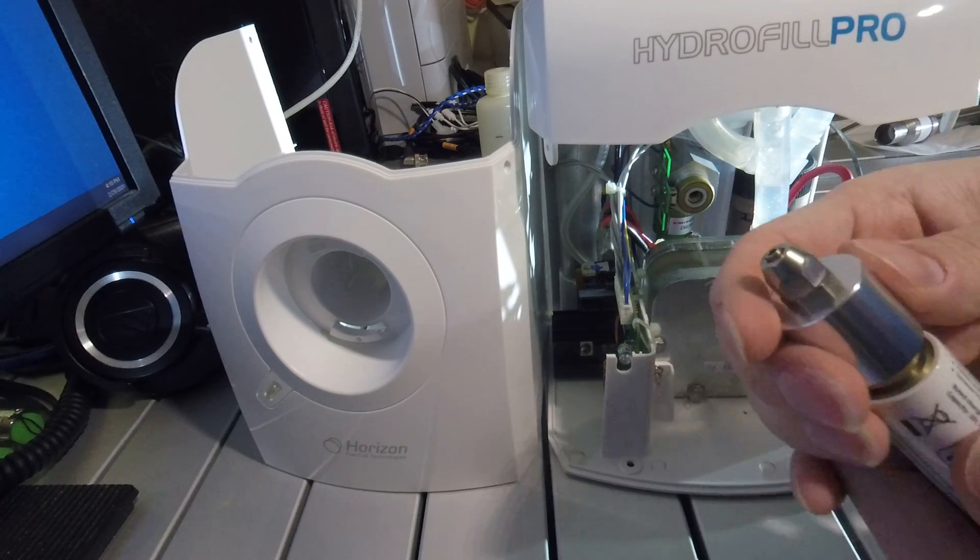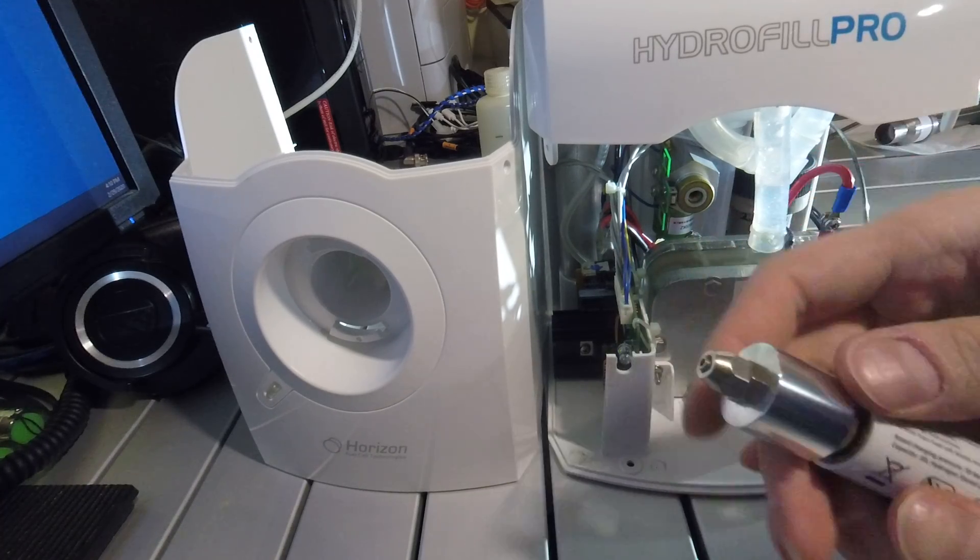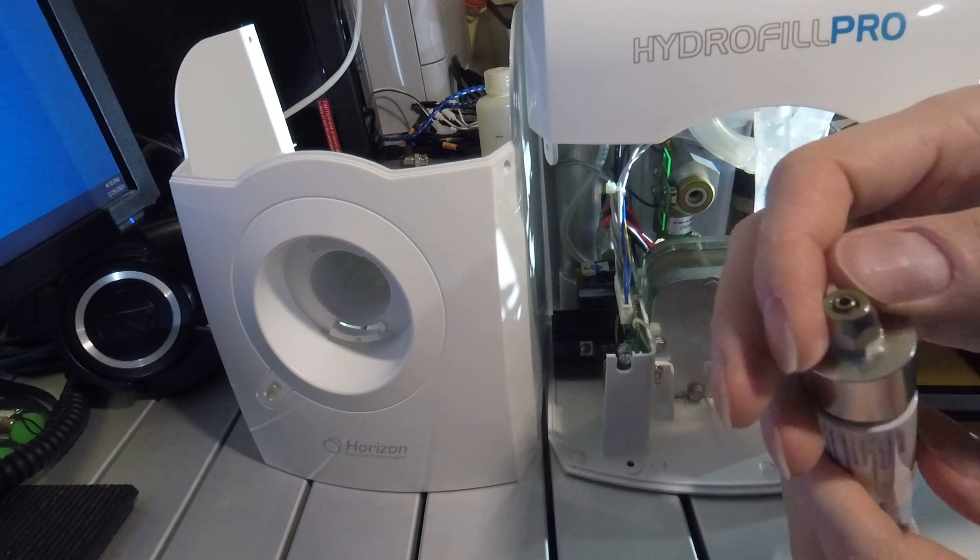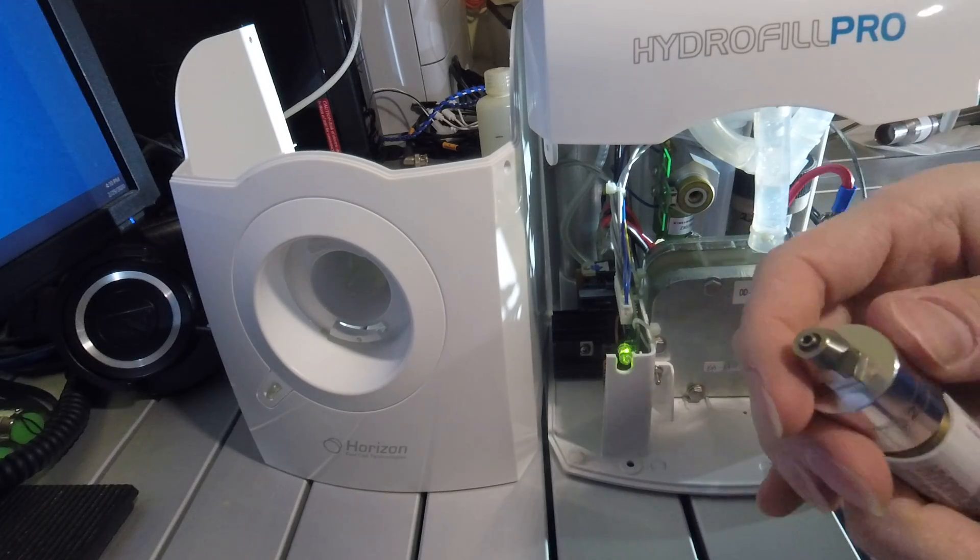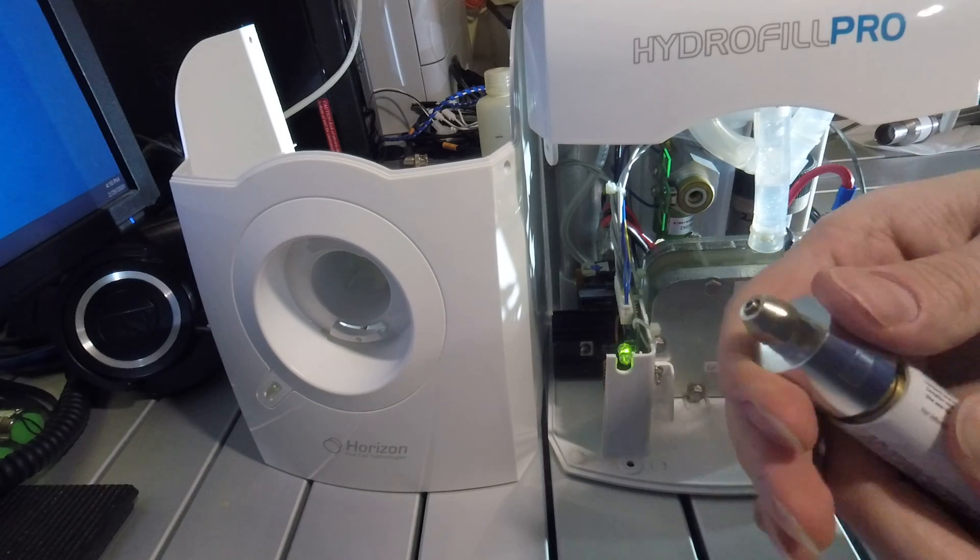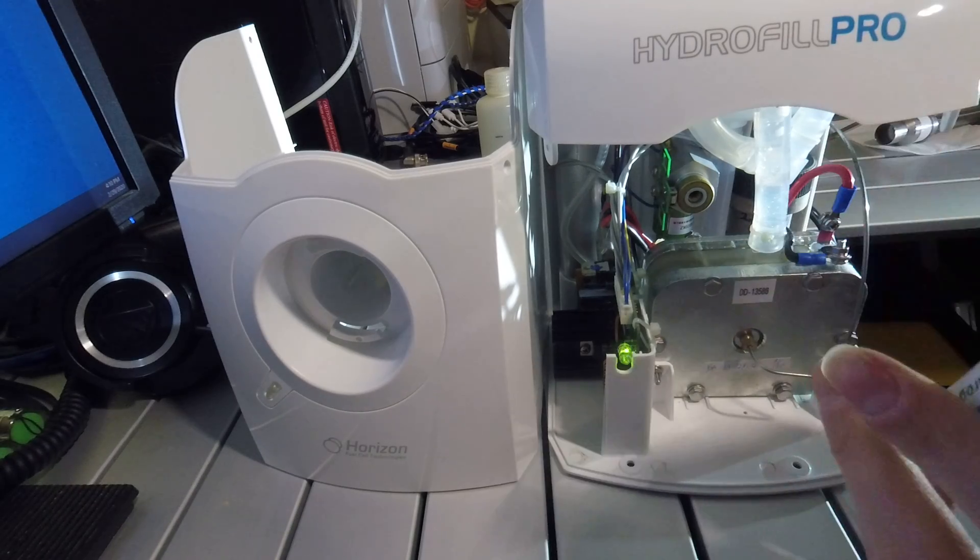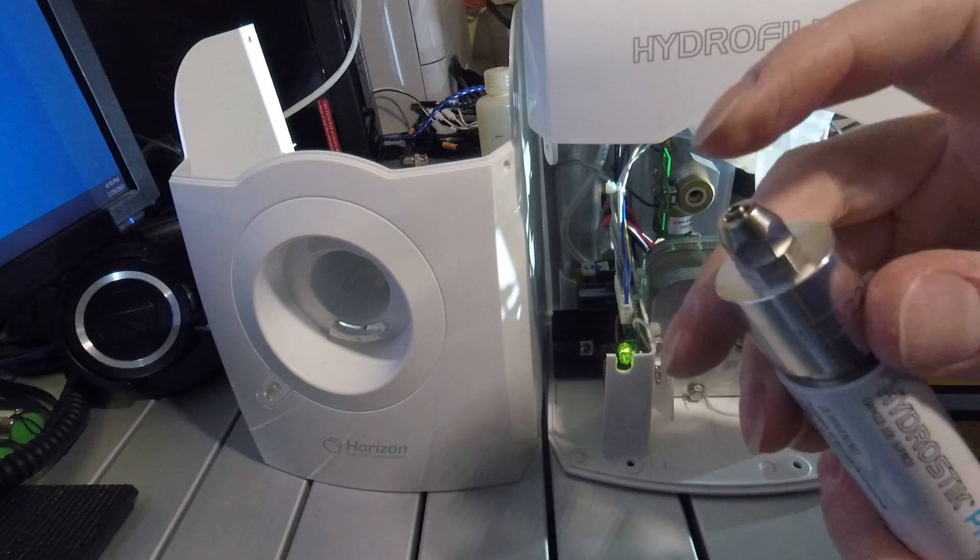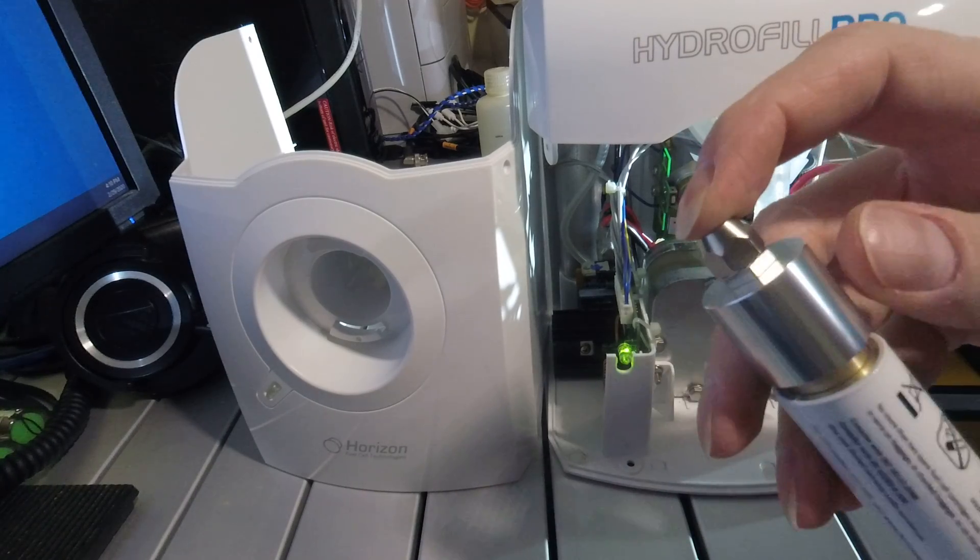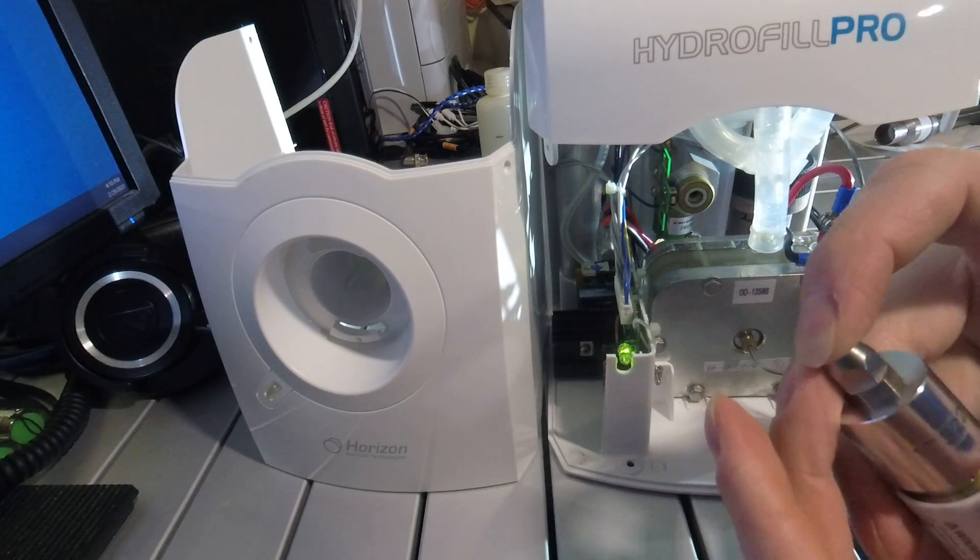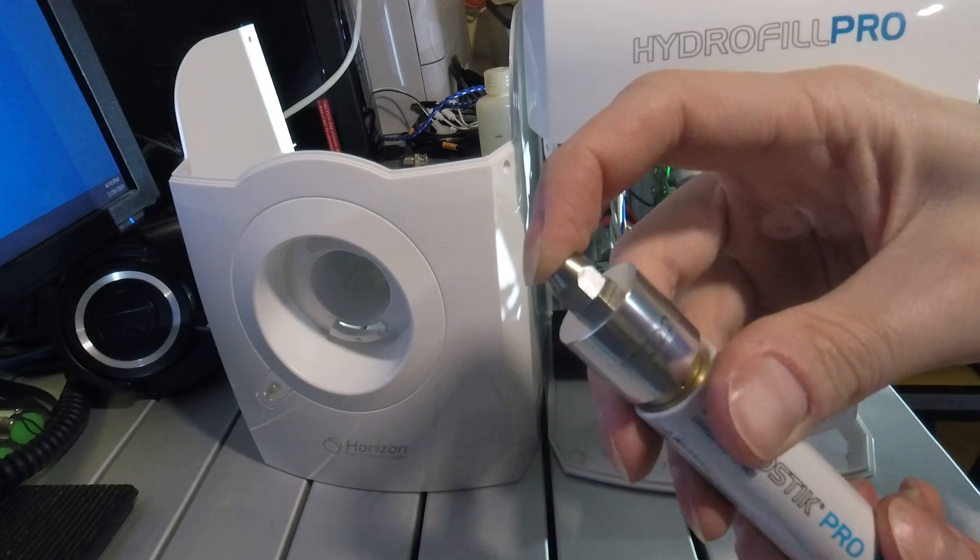For example, if you screw it into the hydrogen cartridge without anything on the output, you'll hear the regulator click, but you won't hear any gas flow. That's because it's designed that if the hydrogen line comes off, it'll shut off the flow automatically.